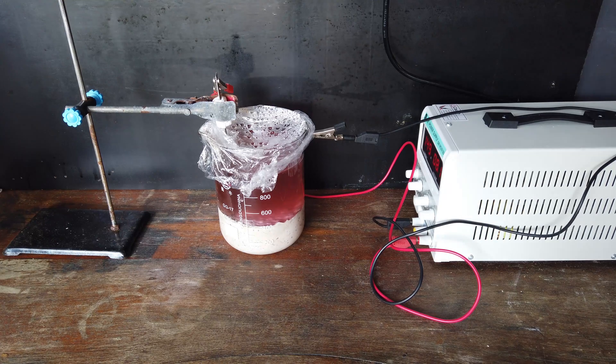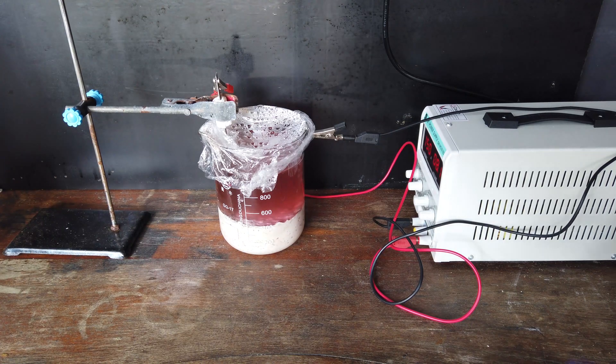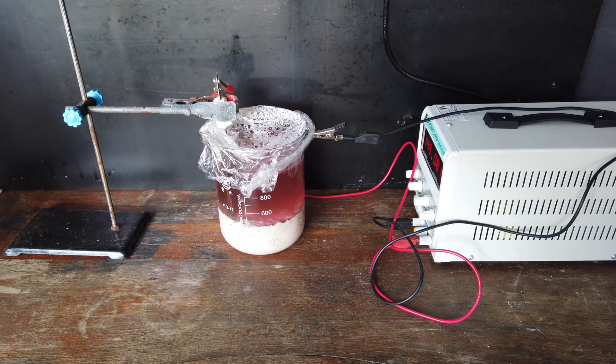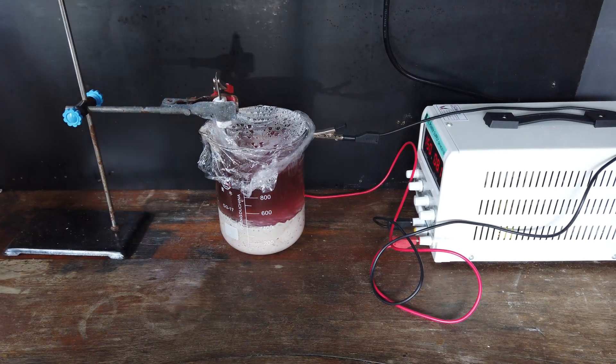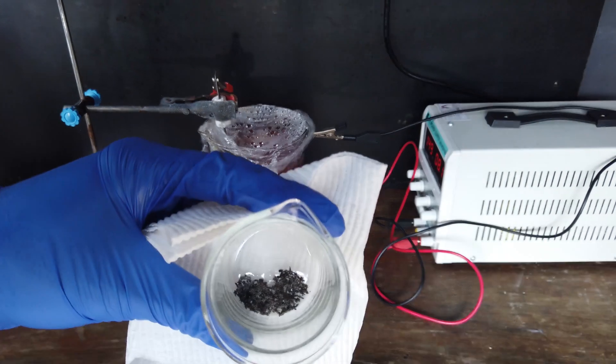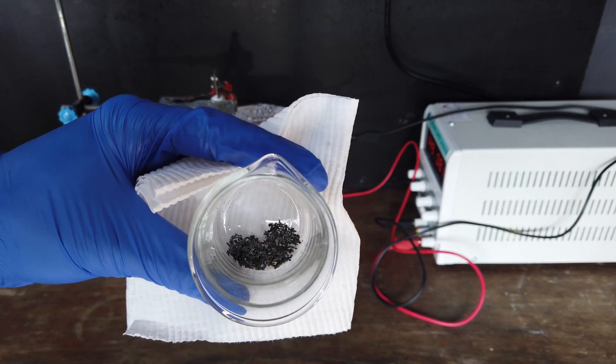So, I think it is a good idea to continually stir it, once a day to keep things dissolved and keep things plating out. But also, within those two days of running the cell, you can see we have also collected quite a bit of transition metals.